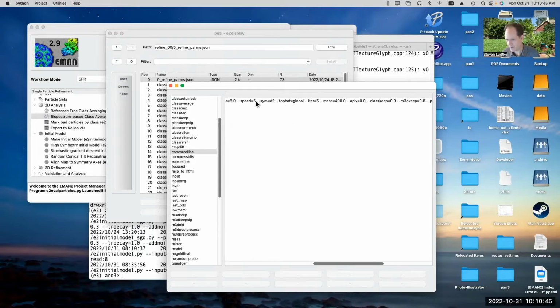Speed equals 5 was my concession to actually running it faster than usual. If you say speed equals 5, it will sample things less, and it'll run a lot faster, maybe 5 times faster or something like that. Speed equals 5 doesn't mean 5 times faster, but it's sort of the default medium value. If you want to run your final full resolution refinement, you usually use speed equals 1, or sometimes 2 or 3 is enough. Speed equals 5 will run a really fast job.